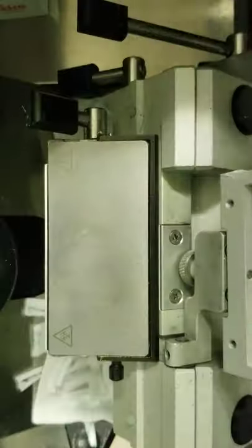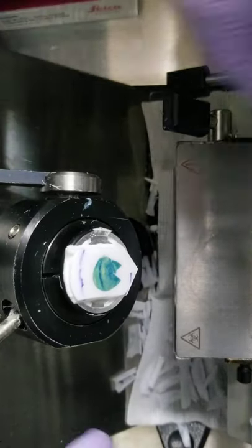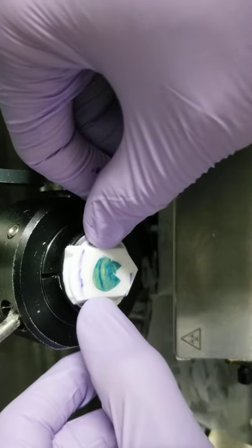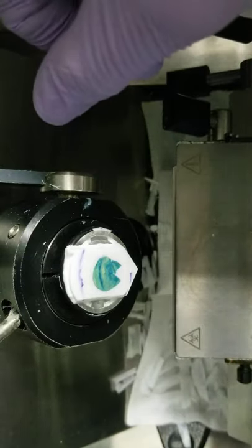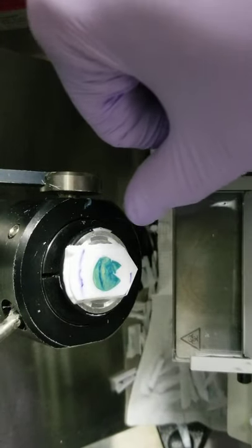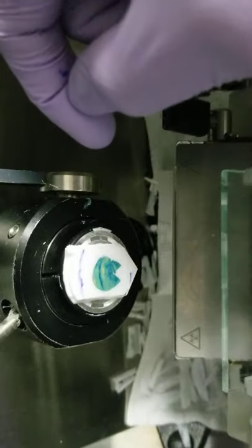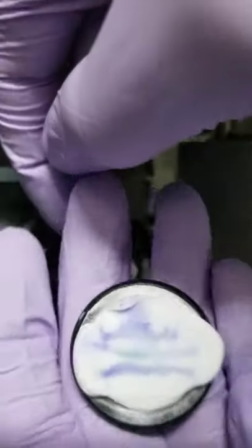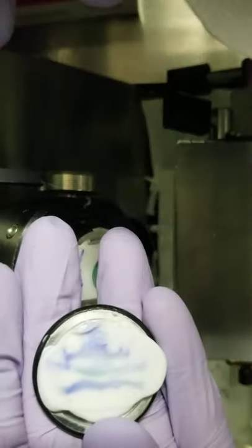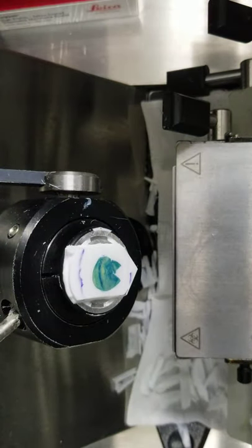And then I always trim my blocks, because you don't want rounded edges. What can happen is the anti-roll plate, the further out you go, can grab that one side and it'll pinch, and the whole specimen will bunch up. So once I've faced into it, or even before I face it, if it's a second layer like this, I'll cut straight lines using a prep blade. That helps with rolling and bunching up on the anti-roll plate. Anyways, hope this helps.